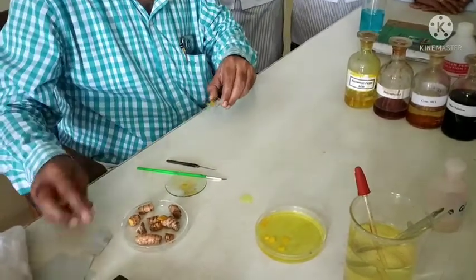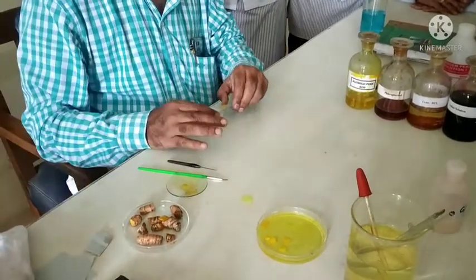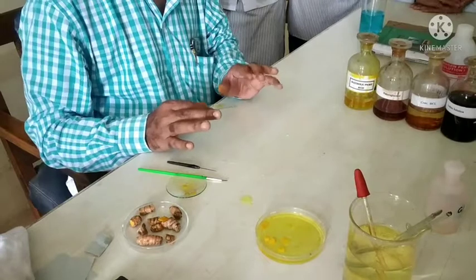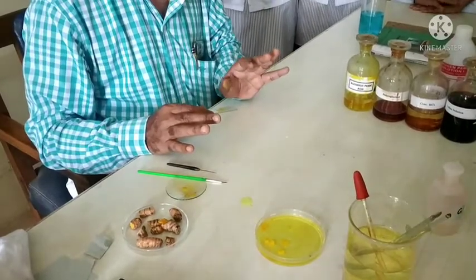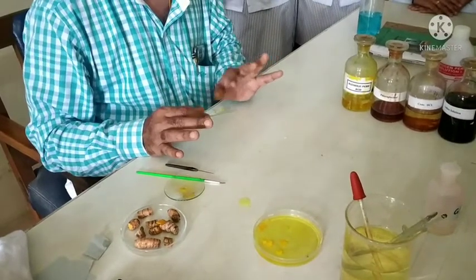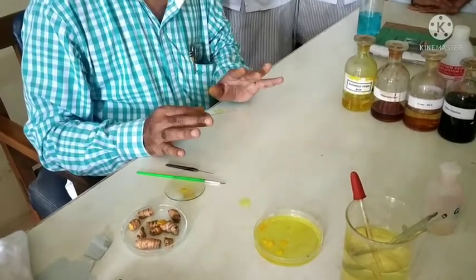So this is the complete cutting technique, staining technique, and mounting technique of turmeric. Thank you.